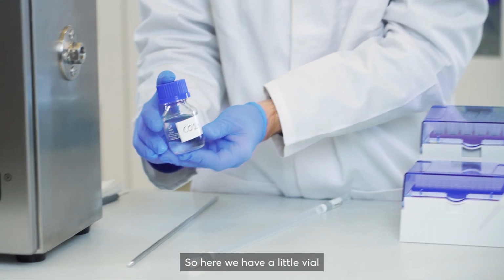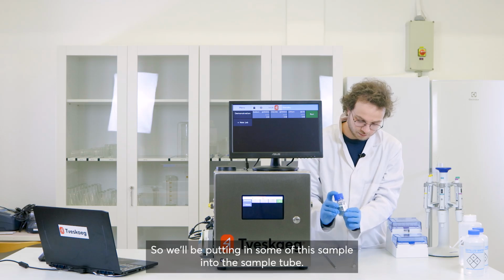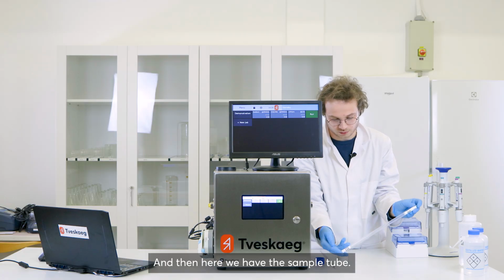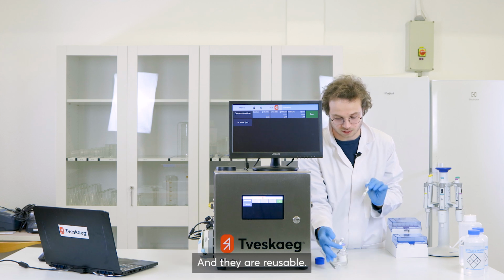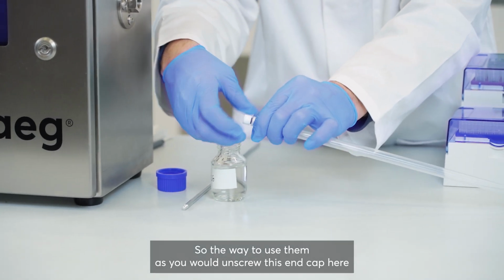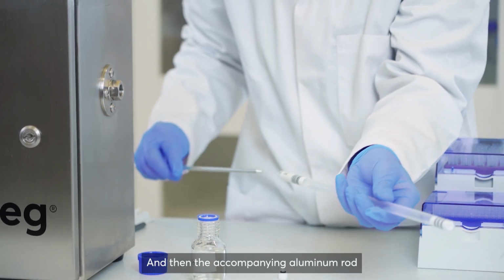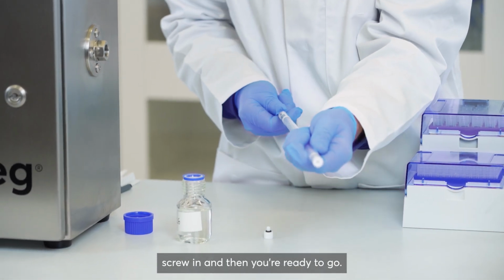So here we have a little vial with a sample labeled CO26. We'll be putting some of the sample into the sample tube. I'll just unscrew the lid here. And then here we have the sample tube, and you get 10 of these with your system, and you can purchase additional ones, and they are reusable. The way to use them is you unscrew this end cap here just with your fingers, and then the accompanying aluminium rod you insert in the tube here, screw in, and then you're ready to go.